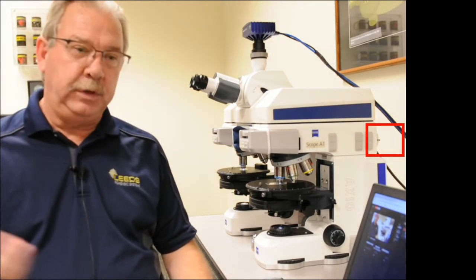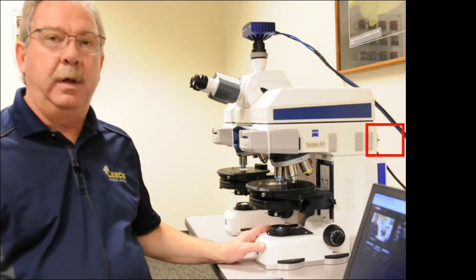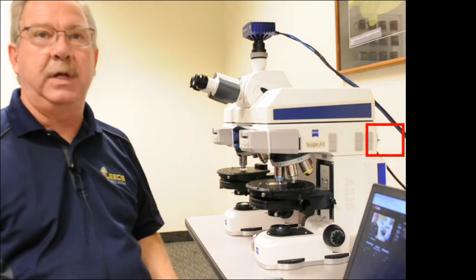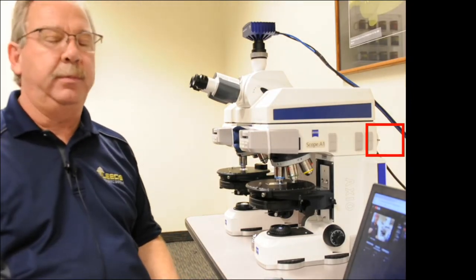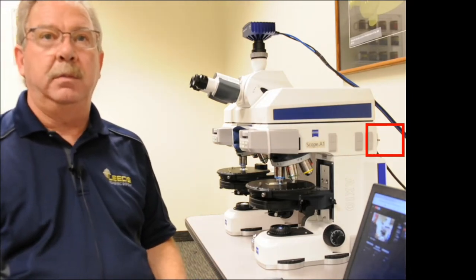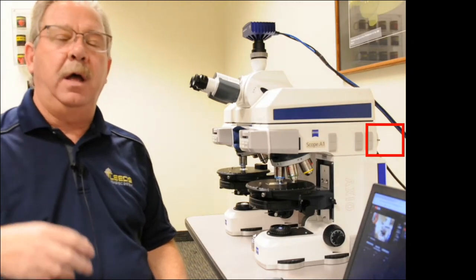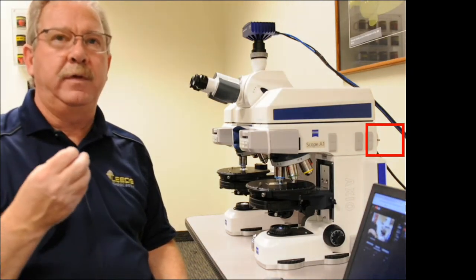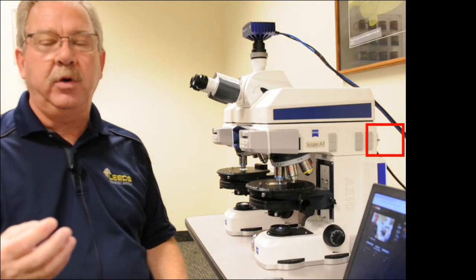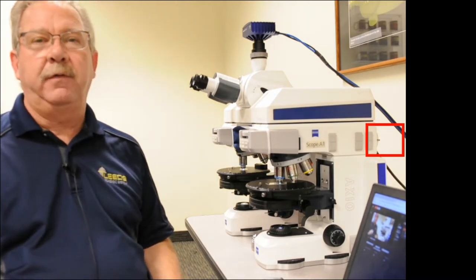The normal use you have for a compound microscope, we set up Kohler illumination and we perform what's called orthoscopic imaging. We're all pretty familiar with that — we focus down on a sample, focus our condenser properly, and look at the sample. In conoscopic imaging, what we're actually trying to do is gather some insight about the crystal structure of the mineral, the chemical, in some cases even a fiber, and try to get more quantitative information to help us identify this crystal.